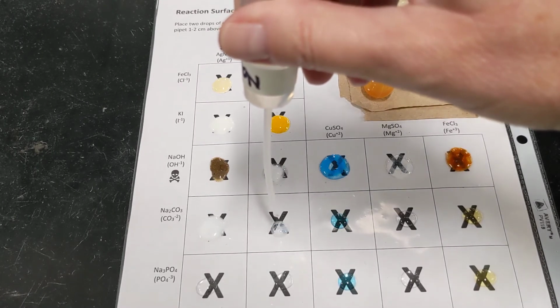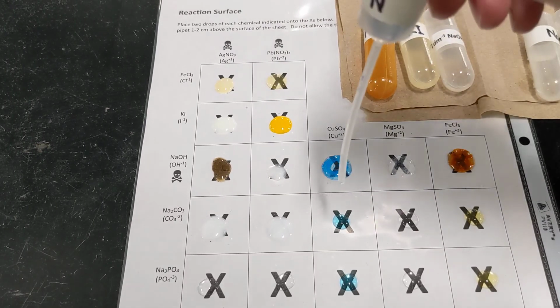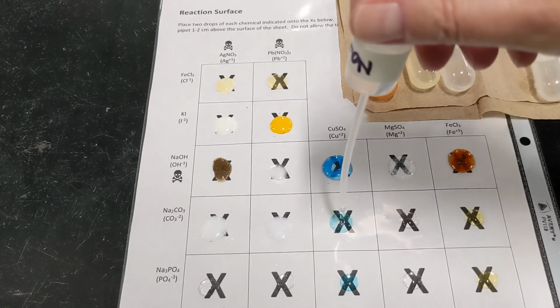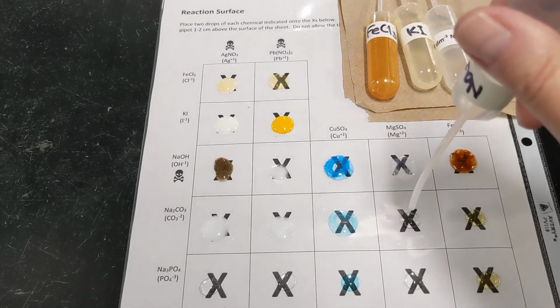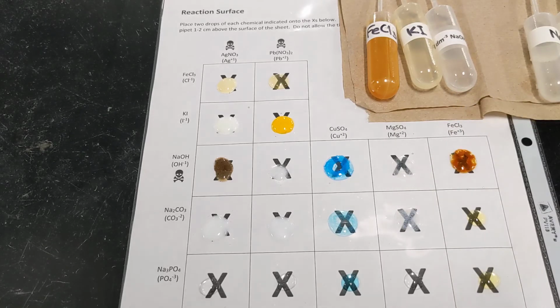So we're getting quite a few white precipitates here. Box 2. Again, white precipitate. Box 3. Wow, this is another one that's kind of slight, so let's give that a few minutes and we'll come back and fill that in. Okay, box 4. There's a little bit of a white precipitate in there. I can definitely tell that I'm having a harder time seeing through the liquid.